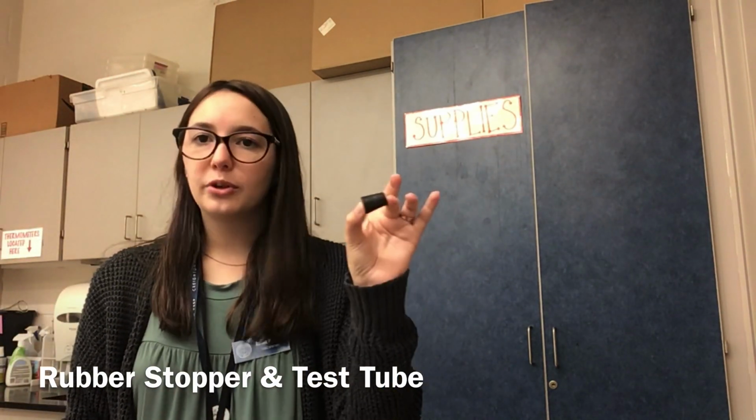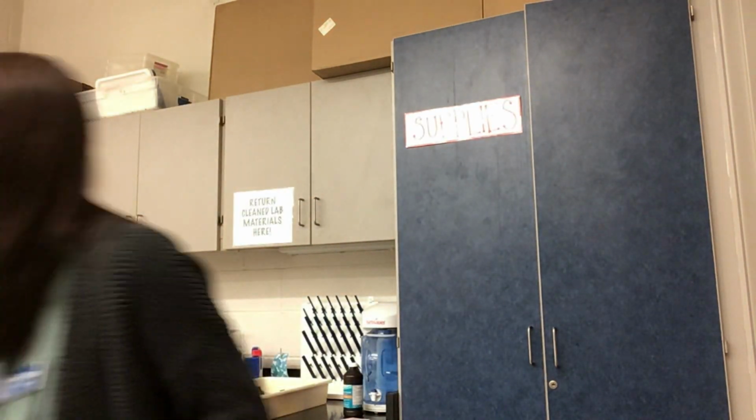Number eight is a rubber stopper. I'm also going to be showing you number 10, which is a test tube. Rubber stoppers and test tubes are used together often. Sometimes I can put a chemical in here and I put water in here that I want to dissolve rapidly. To dissolve it rapidly, I can speed it up by shaking up my test tube so that it dissolves quicker.